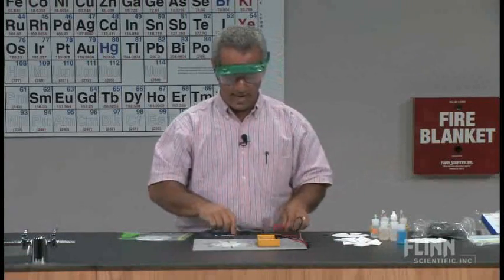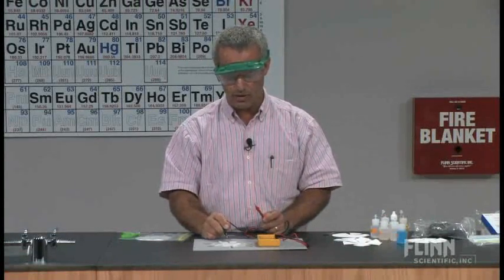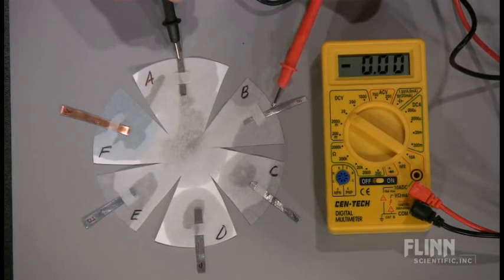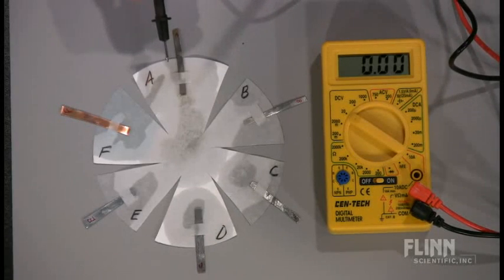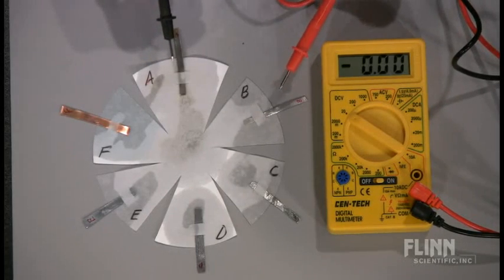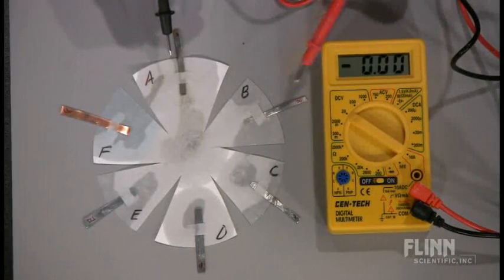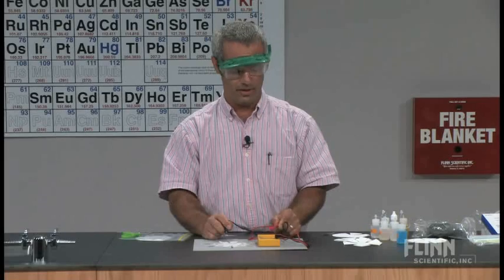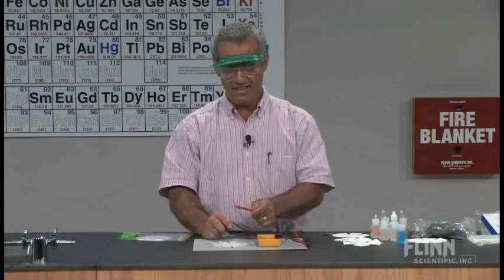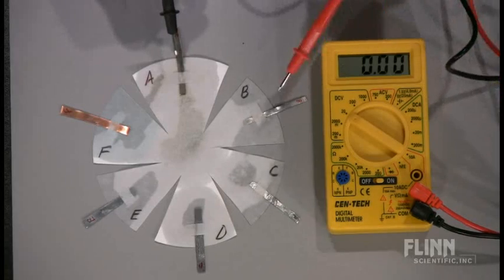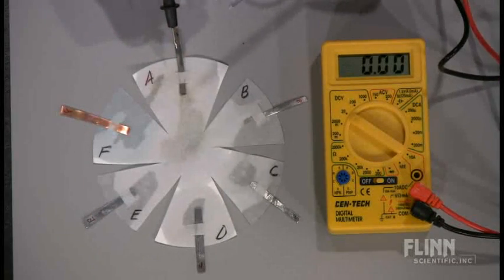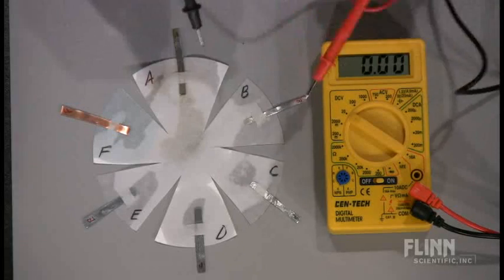We're going to pit these up against each other. When I put the black electrode on one, and I'm putting it right here, couldn't be easier, and the red electrode on the other, what I'm assuming is electrons are flowing from the black to the red. If they're flowing the other way, it's okay. I'll just get a negative reading here. This is indicating to what extent, with what force, driving force, electromotive force, the electrons are flowing from the black to the red. But if they're flowing the other way, if A is the better tug of war, then it'll just be a negative.